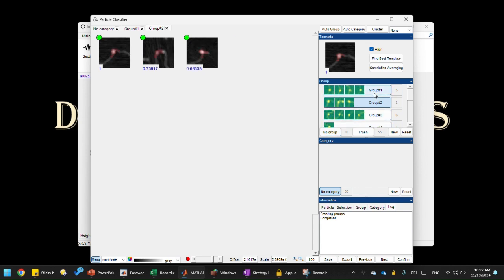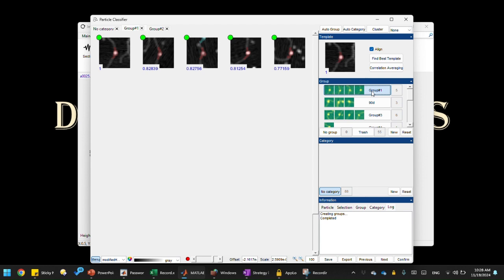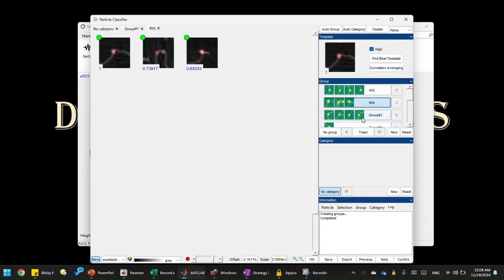What I would do is rename this because I want to keep track of things. Let's say this is a 90-degree bend. The second one may not be, but let's just do it for now. And the first one, I think it's maybe a 30-degree or 45-degree bend. This is not an exact, precise angle measurement, so it's just rough. It's a rough alignment. Even if you do bend angle analysis, you usually will have a broad distribution. You can imagine this is a broad distribution. This is essentially a low bend state that it tries to classify, and this is more like a high bend state. Let's turn to group 3.